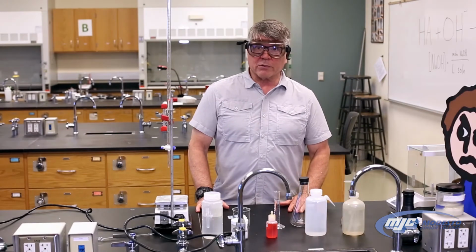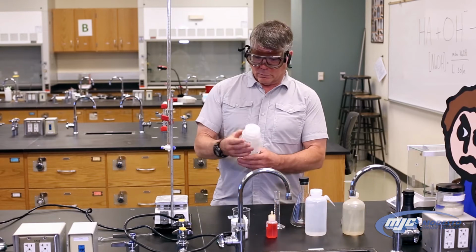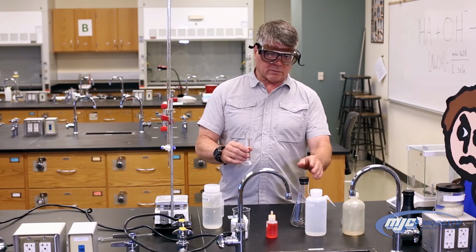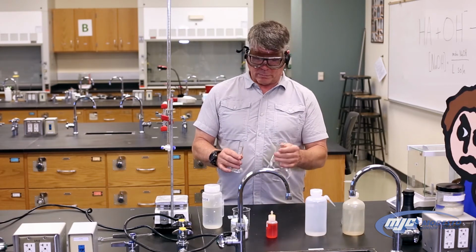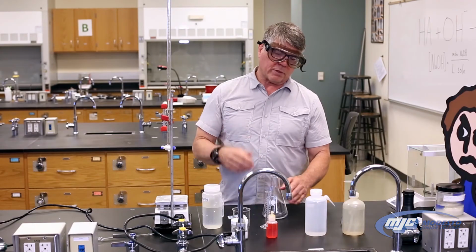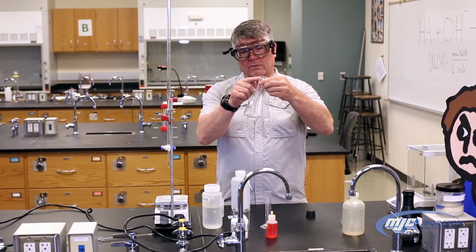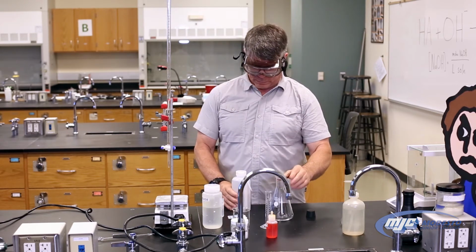All right, guys, so we're going to start by making our stock solution of sodium hydroxide. To do that, we're going to use some roughly 6 molar sodium hydroxide. And I measured out about 25 mils. This doesn't have to be exact, just roughly 25 mils. I have a 500 milliliter Erlenmeyer flask. Just put the sodium hydroxide in there. And in the procedure, I say add 475 mils of DI water. You don't have to measure it. Here's all you do. See how this flask has this neck right here? If I just add water until I get up to about that neck, that'll be plenty good.